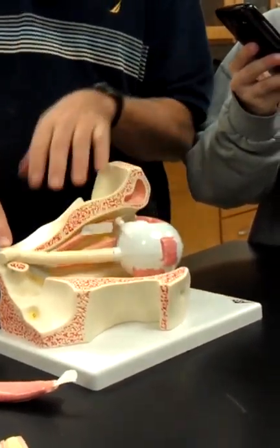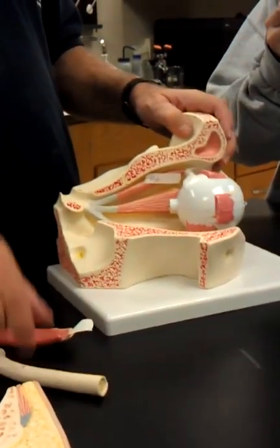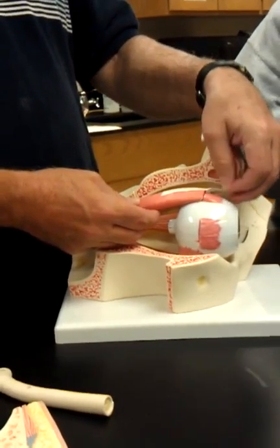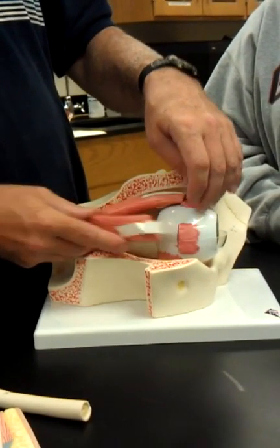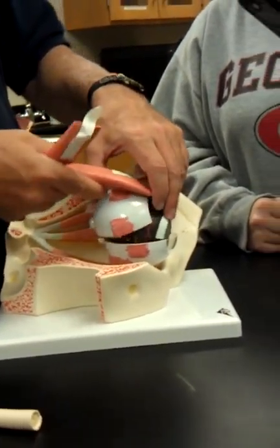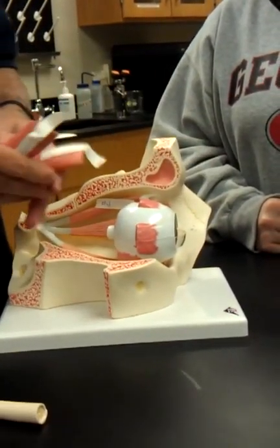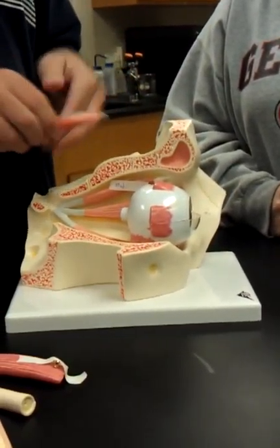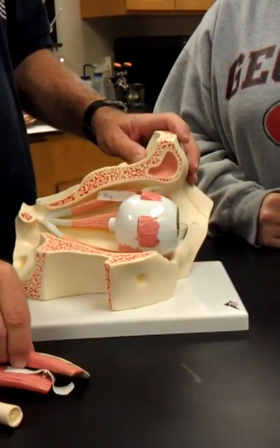Join right here to form the optic chiasma. Okay, so I'm going to take this off and let's put these muscles back. These muscles actually look like they're with each other. I don't think I'm going to mess with these. I'm just going to put them aside. But this one would be a muscle here, then there'd be a muscle there. But I'm just going to set them aside.